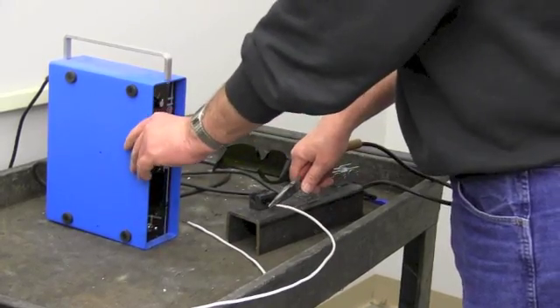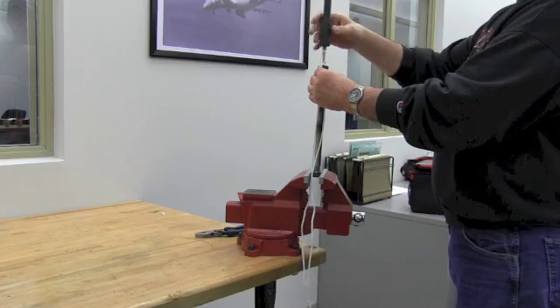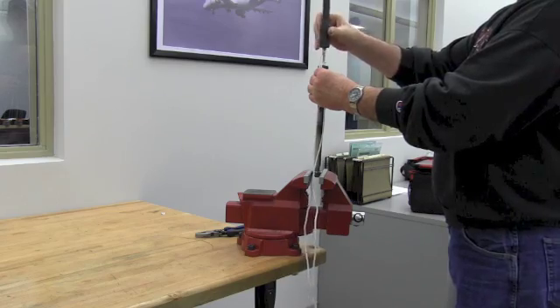He then makes thermocouples by welding and attaches them to the specimen to allow the temperature and temperature gradient to be monitored during the test.